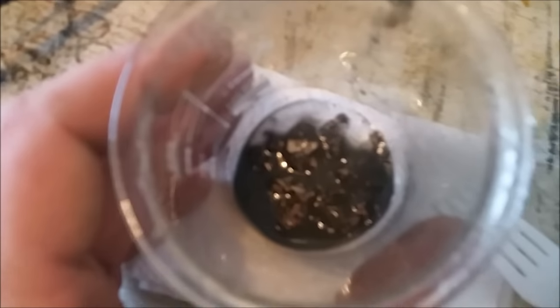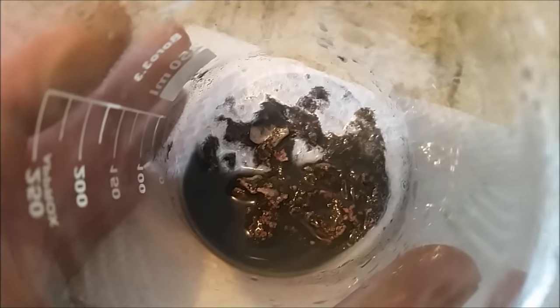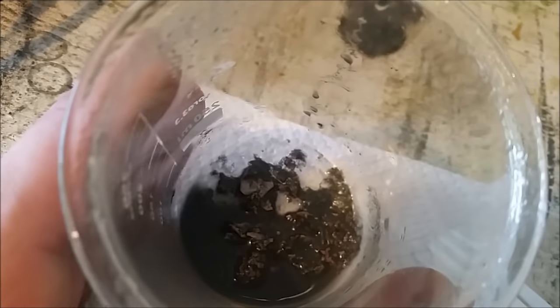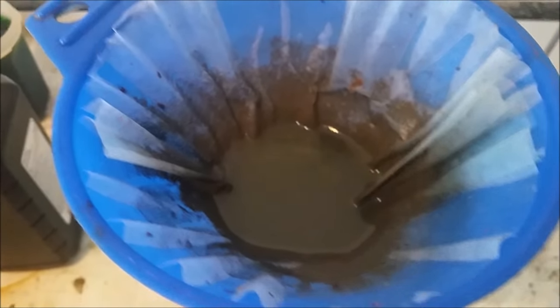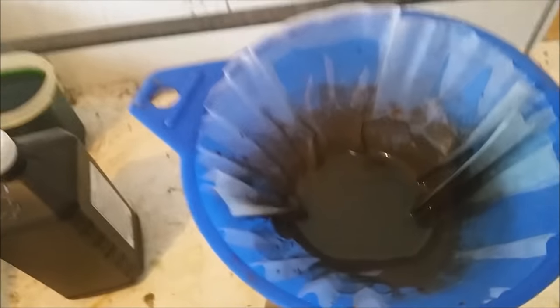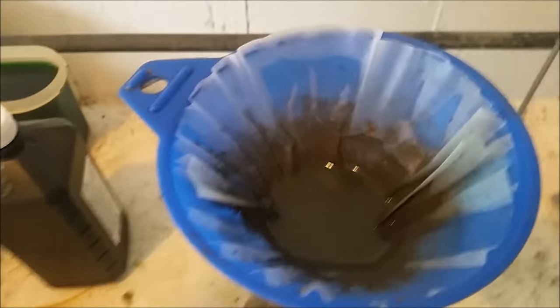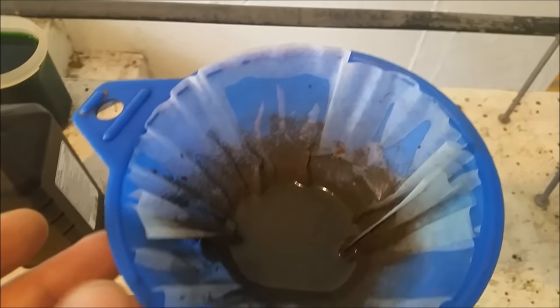I got that mud washed out and into a beaker. It looks like there's still a tiny bit of copper in there. I see some gold flecks, but the grand majority of what's left in here is white metal, as well as this grayish precipitate. Whenever I was watching the acid peroxide mixture eat through the copper, I was watching that precipitate fall out, and so that's a good indicator it's probably silver. Silver chloride is not really soluble, so it's going to fall right out of solution. And then on top of it, you're going to have the copper that's dissolving cementing the silver out. So you're going to get a decent little mixture of silver oxides and silver chlorides.